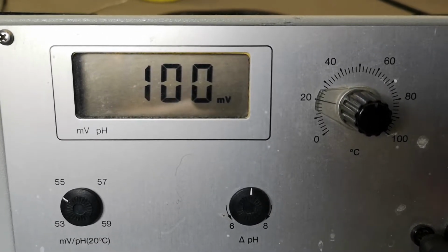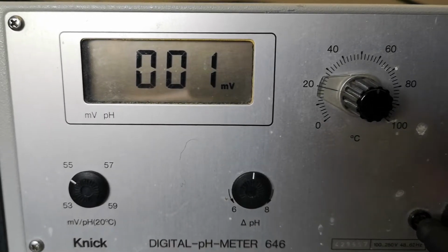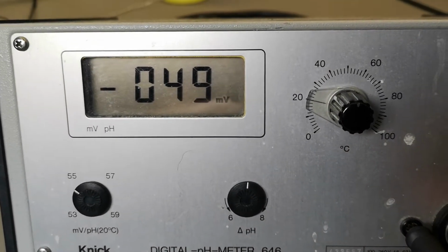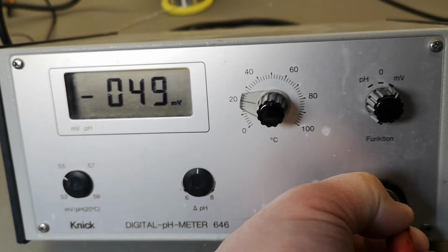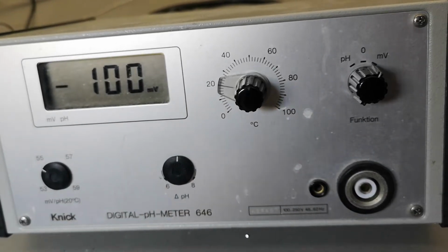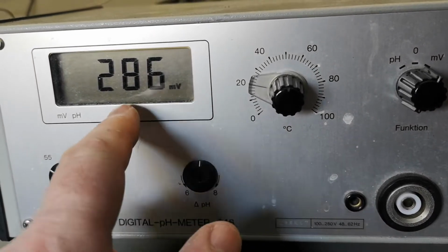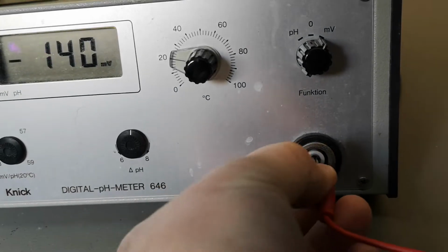12. So there's some sort of a limit when I input the voltage here for real, and now this is my 0, and even if I reverse the voltage input and then go up again to 50 millivolts, it reads out pretty well the millivolts correctly in positive and negative. But how is it possible for the thing to read a value that was higher? Before it was higher, right? What did I do? You see? But how can it read something more than the 100 when I know that I input more than 100 from the bananas? That is something I don't understand.